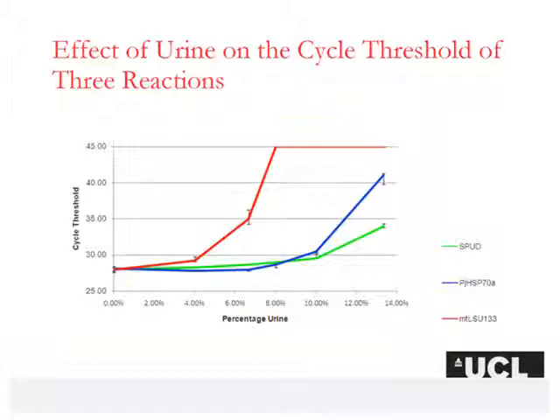So now we can see that the presence of the same inhibitor in an assay has a different effect on different qPCR assays. So therefore, when you are performing a normal experiment of, for example, measuring one concentration relative to another, as in a normalization, you can see that the presence of an inhibitor would completely destroy the real ratio you were expecting to record.